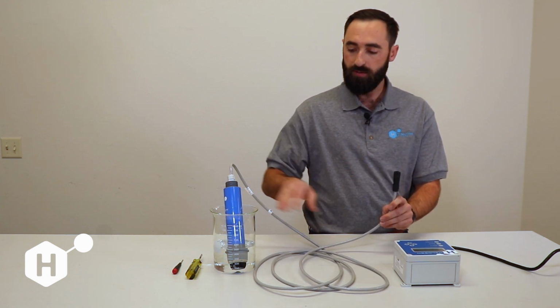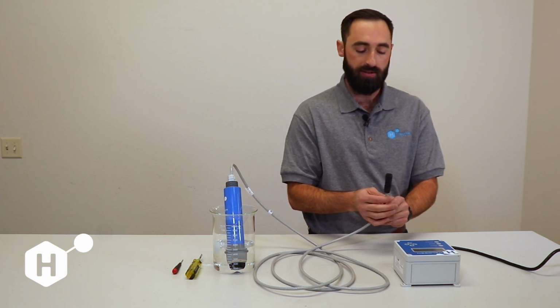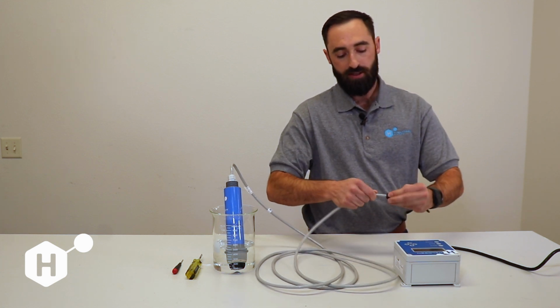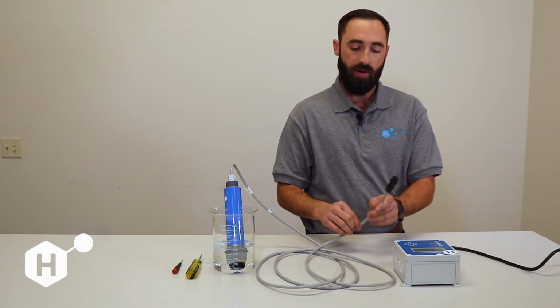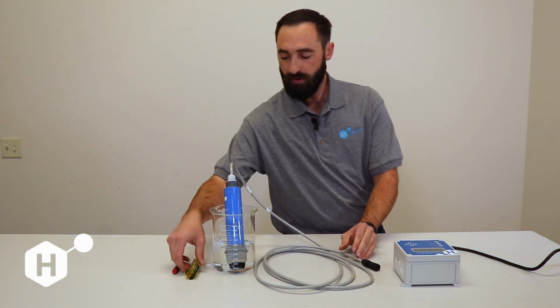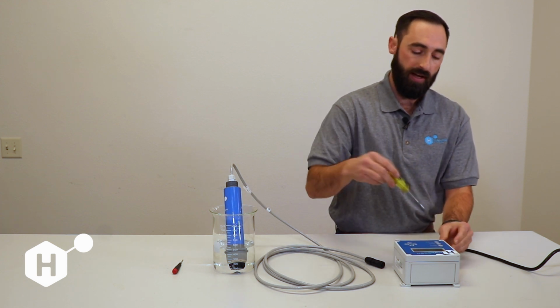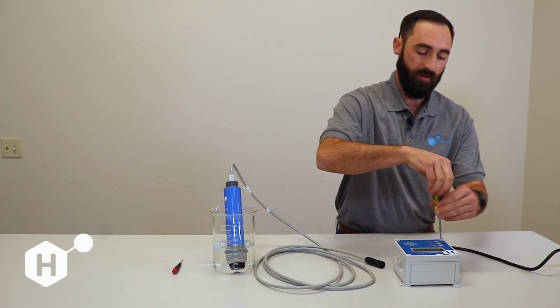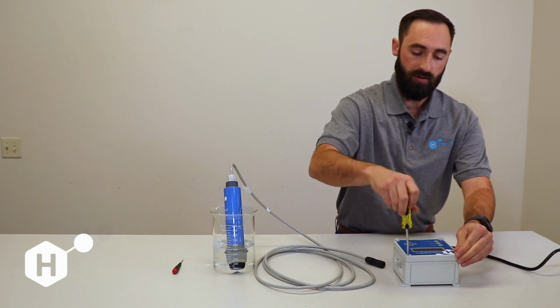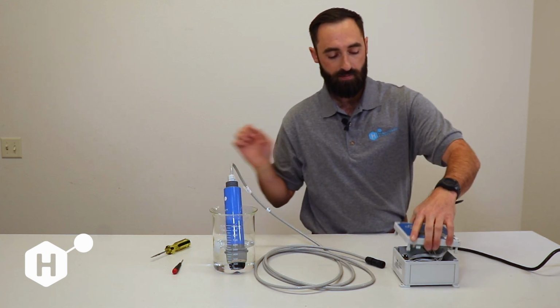The times that I'm going to do this is if this sensor is not powering on at all, then I'm going to want to pull this connector apart, make sure that everything's connected to the right terminals, that you have the right pin out. Also, these can get twisted during installation, especially if you're running your wires through conduit. So definitely one of the first things to check is your M12 connections here, as well as confirming on the display board itself. And you can just use a flathead screwdriver or a key to remove the faceplate. So if doing that bus search doesn't work, then we're going to want to check our hardwire connections here, especially if our sensor's not powering on.